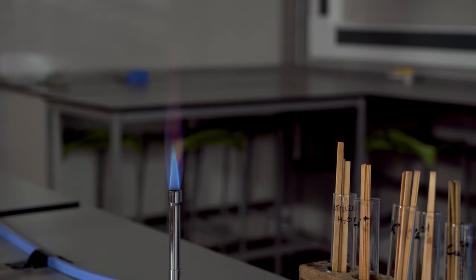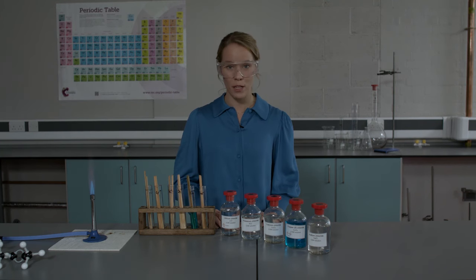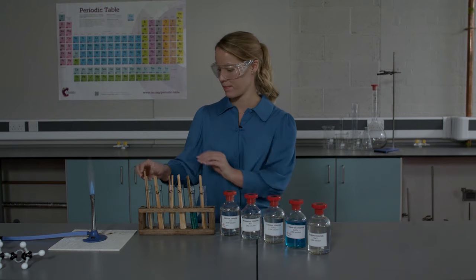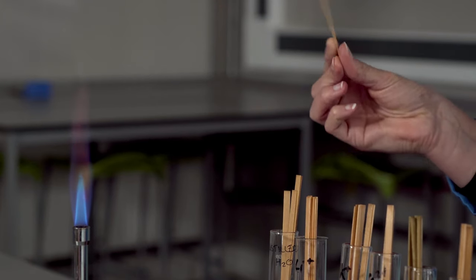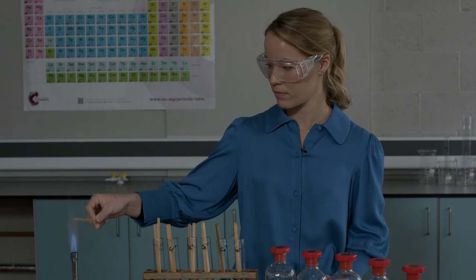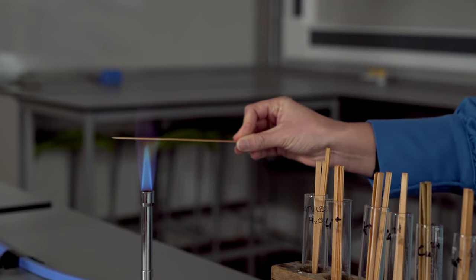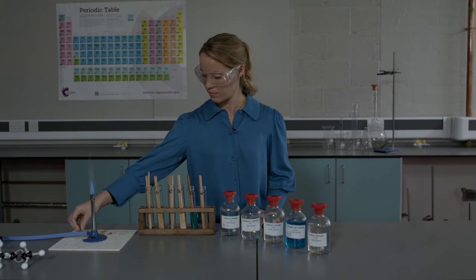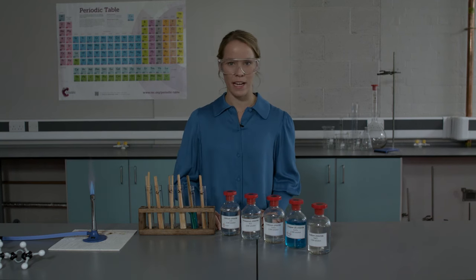I'm going to start by testing the splint dipped in distilled water. This is so we can see what flame color we get when there is no metal ion present. I'm going to gently hold the splint over the Bunsen flame, and I can't see any flame color here.